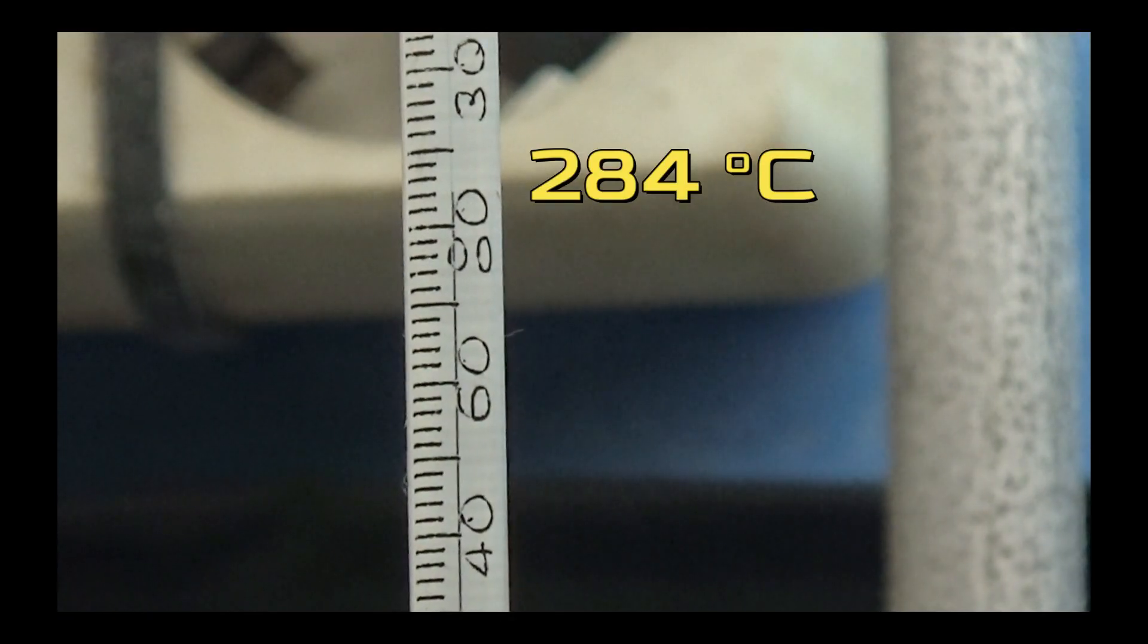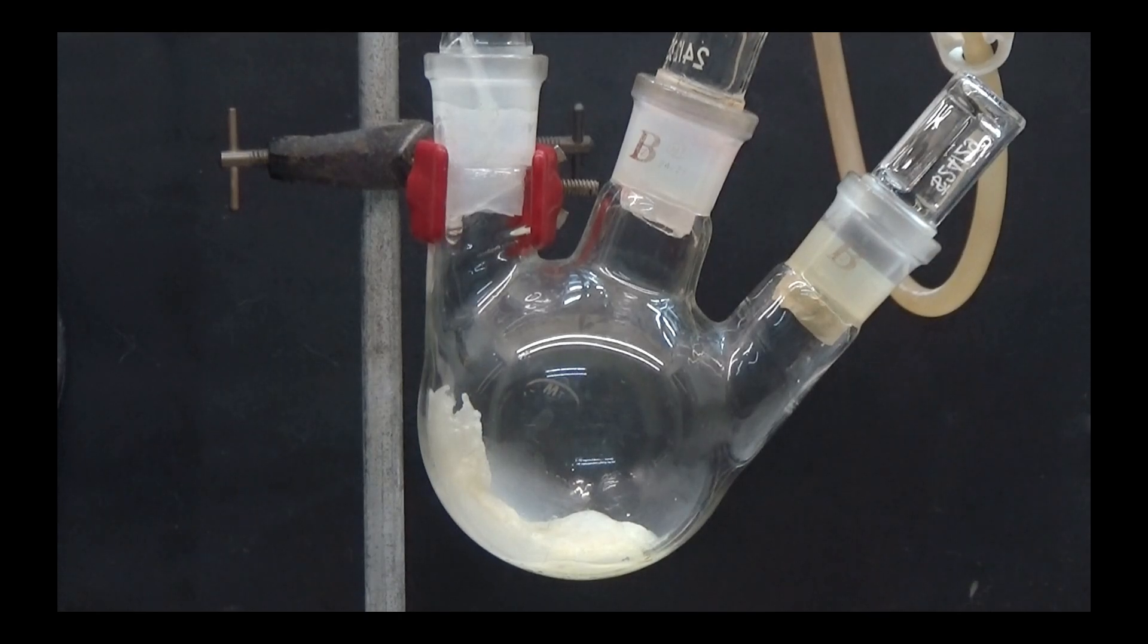At 284 degrees, the vapor temperature generates a thick liquid that solidifies into a white compound when it reaches the receiving flask.